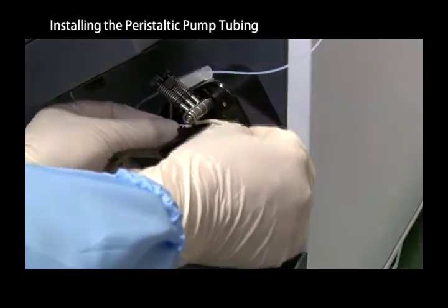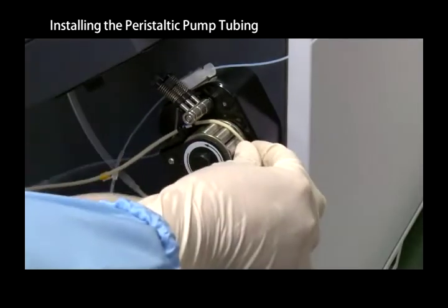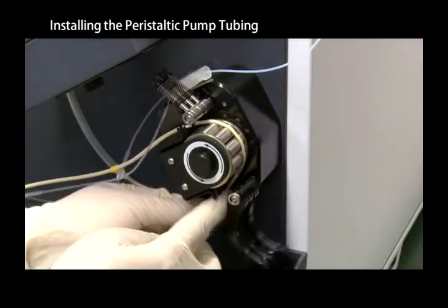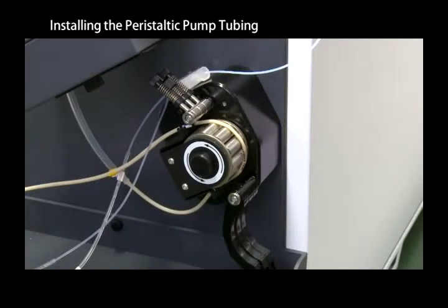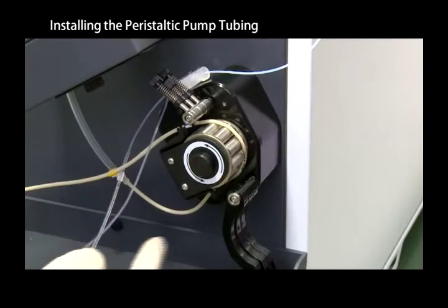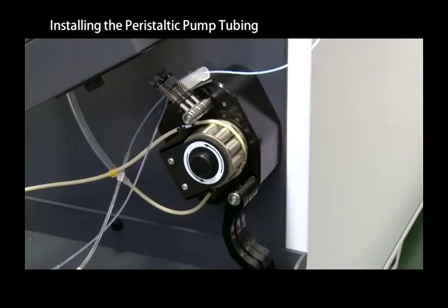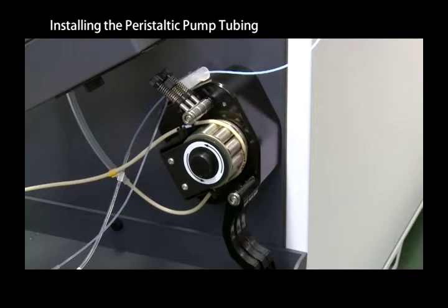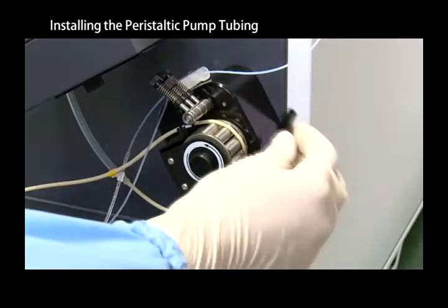Hang the upstream drain tube stopper over the top of the peripump. Stretch the tube over the rollers and hang the downstream drain tube stopper underneath the peripump. Recheck the direction of the peristaltic pump rotation and confirm that the drain flows toward the drain vessel. Clamp the tube by dropping the lever.